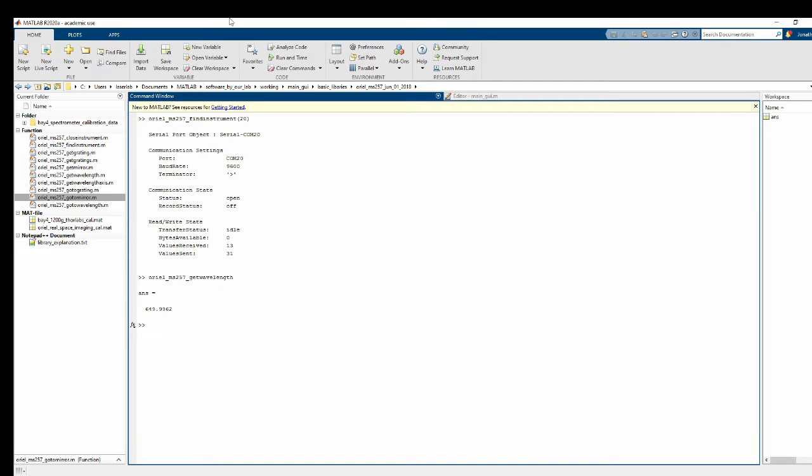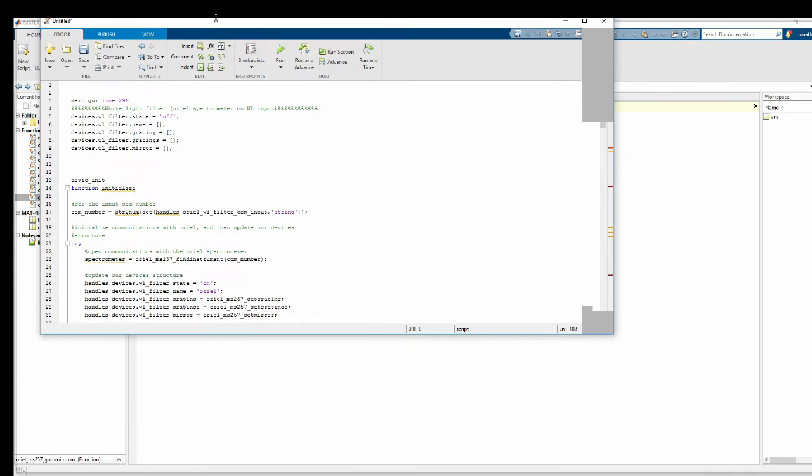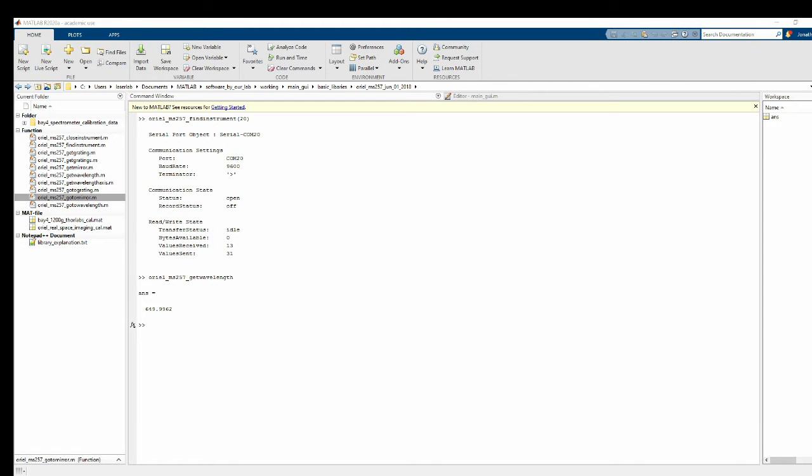So once you've got your basic library, then we want to start adding this into main GUI and creating some buttons to control it, make sure we're saving data, things like that. I've got a bit of an outline for myself here, so I'm going to try to make it so you don't have to sit and watch me type code too much. I've already got the code written out over here in a separate file. So hopefully we can make this go pretty quickly.